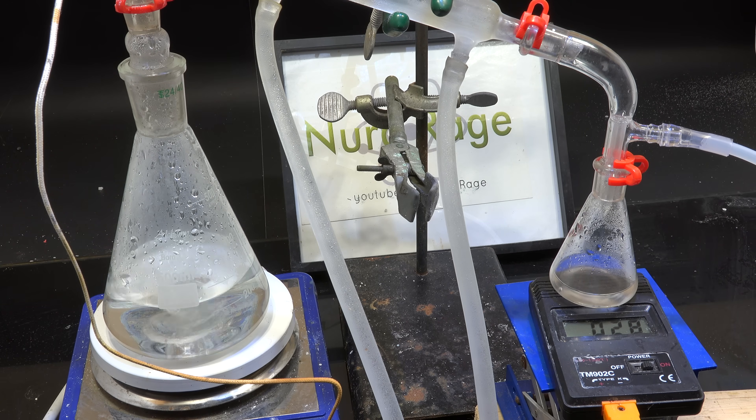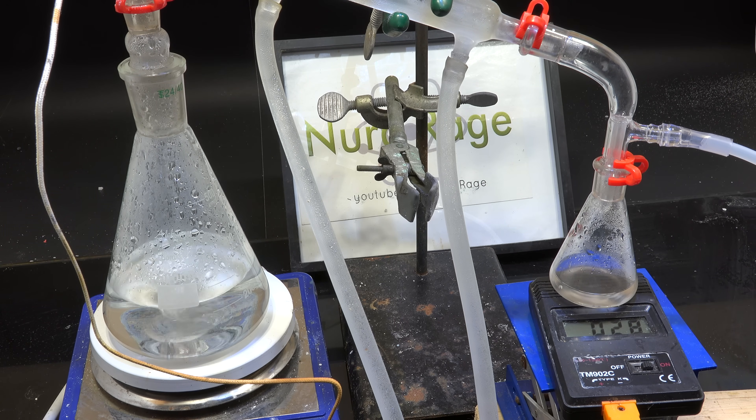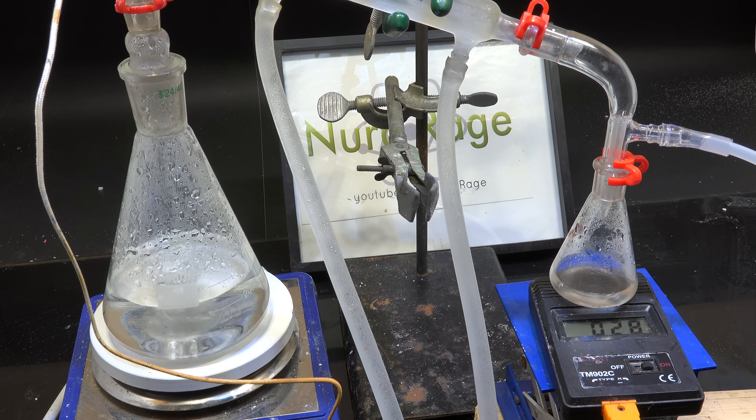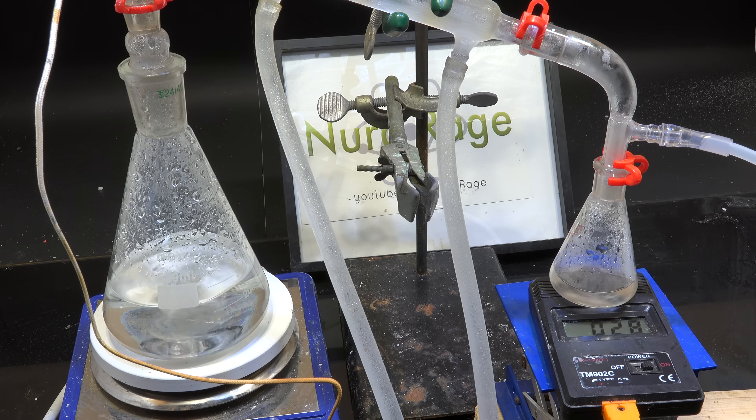We're now distilling at 28 degrees. Quite an improvement from before. And it looks like we're still pumping down and improving the vacuum so we may get even better numbers as we wait.